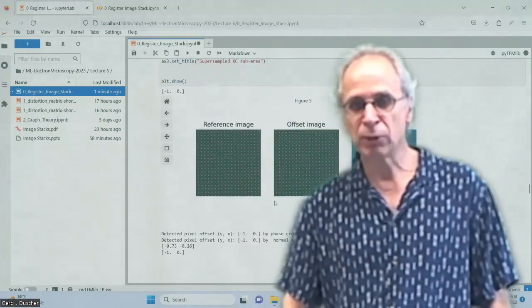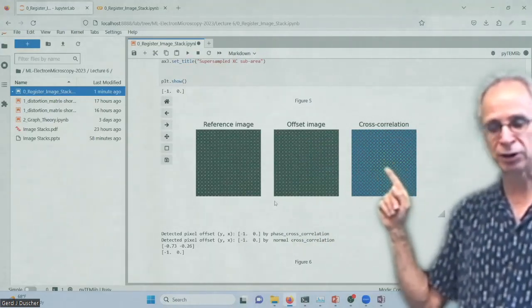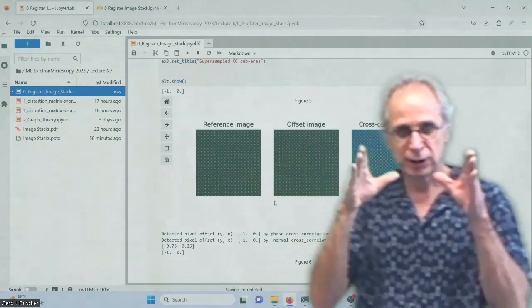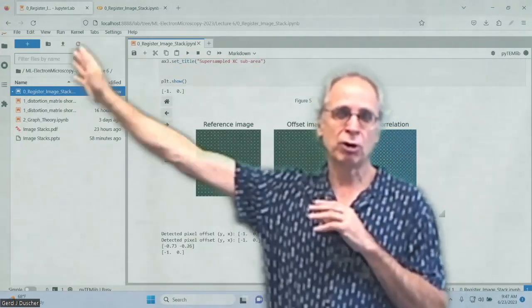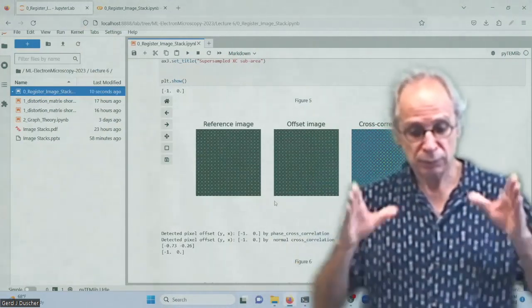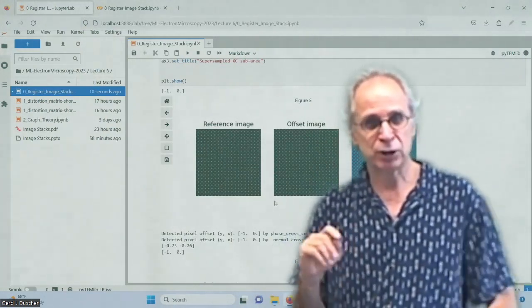So if you do a normal cross correlation, and that is what I did, I just do a normal cross correlation, and you can see from one picture to the next. That's how I do that. So one picture to the next, and obviously if it goes all over the place, I'm not using any of this. So it has really small drift from one image to the next.